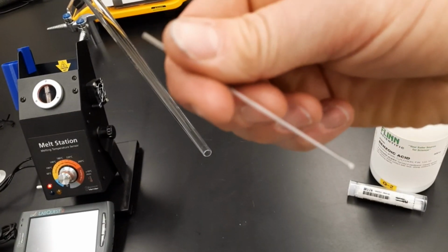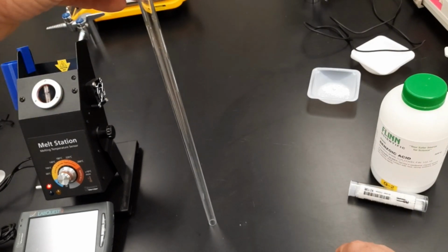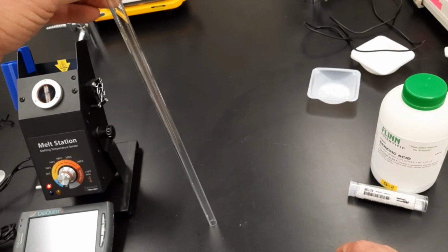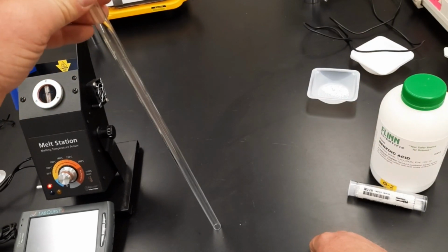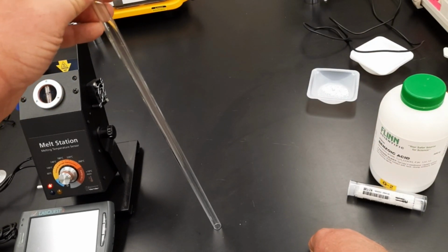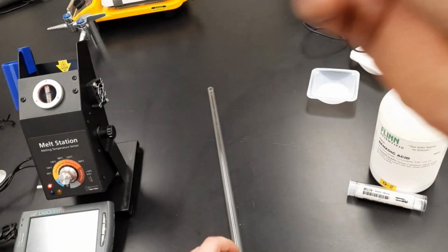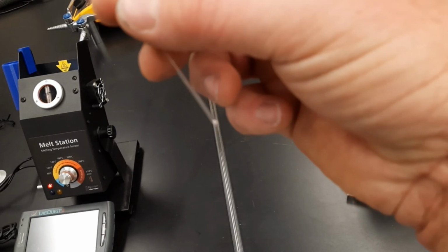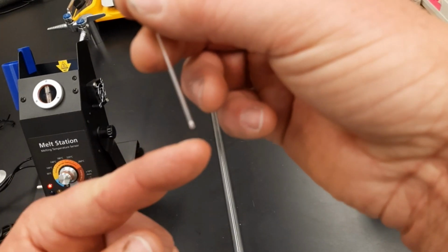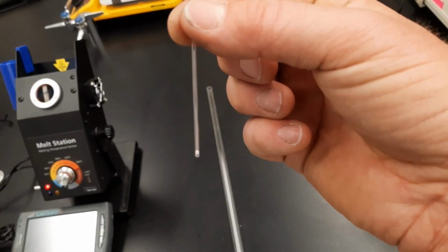It's already hammered down a little bit. Let's do another drop. I'm going to do one more drop. Now, benzoic acid does this very well. Not all chemicals do this. What I want you to note is that you just need the tiniest bit in there to hammer down. And if you can see it at the end there, you can see it. And this is all you need to do with your sample for a melt temp.